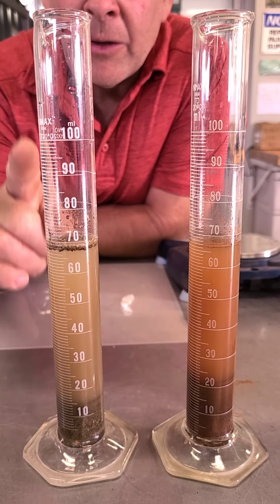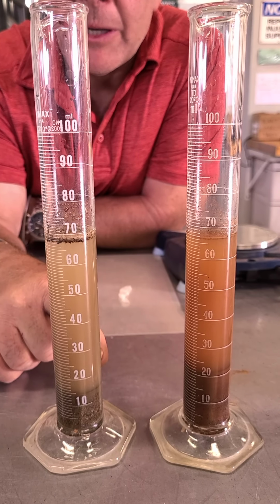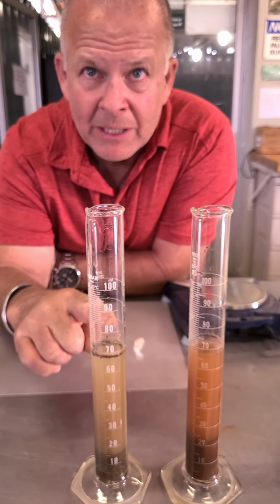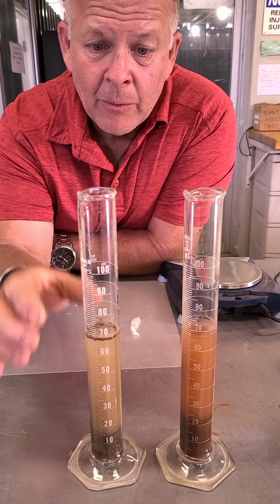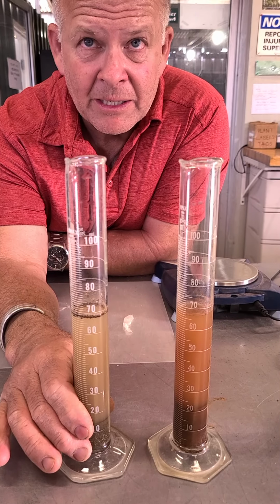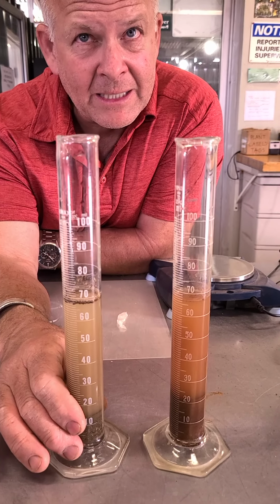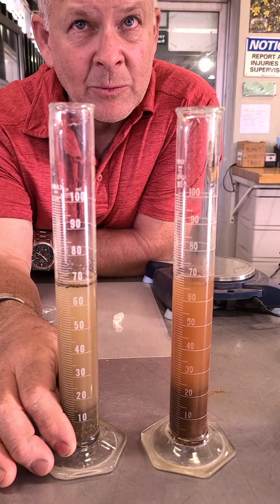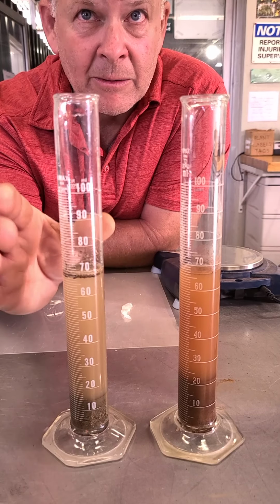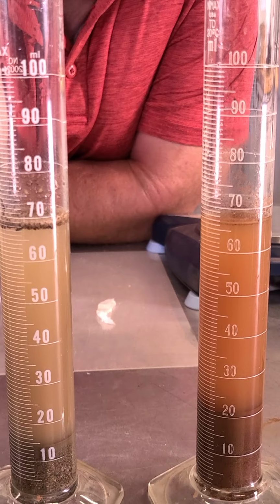So we know exactly how many grams of soil, 20 grams, goes in there, and we know how much water we've put in, we know we put in 60. What is it reading right now? Well, this one right here on the left, which is a sandier soil, is reading 69. So 69 mils, but we've only put in 60. But we've got 69 displacement. So that means that 20 grams of soil displaced 9 milliliters worth of water, because otherwise, if it didn't displace anything, when we put 60 mils of water in, it'd be 60, right?